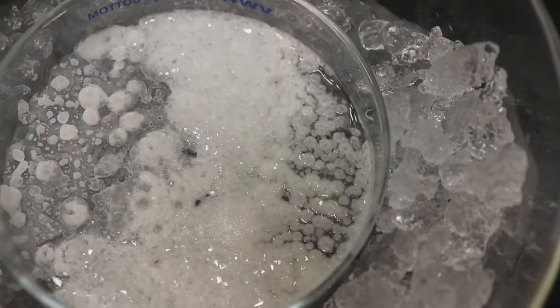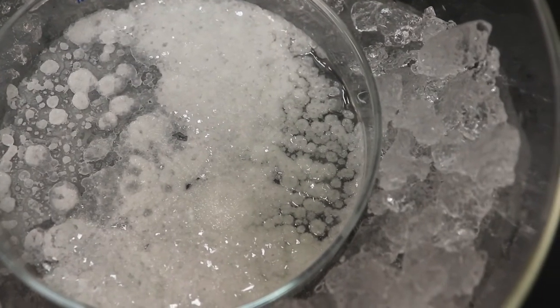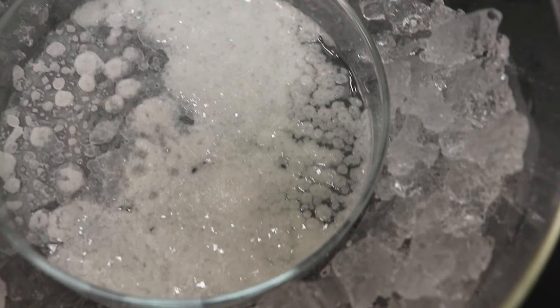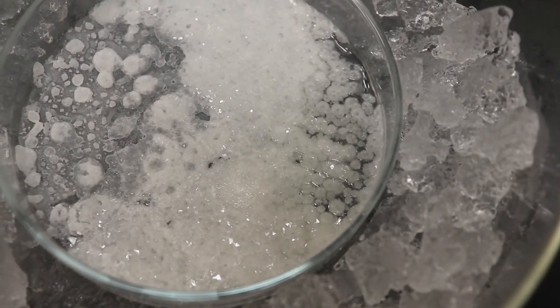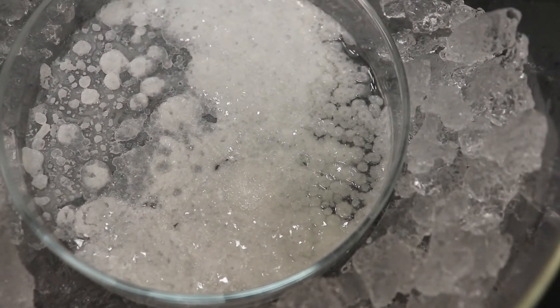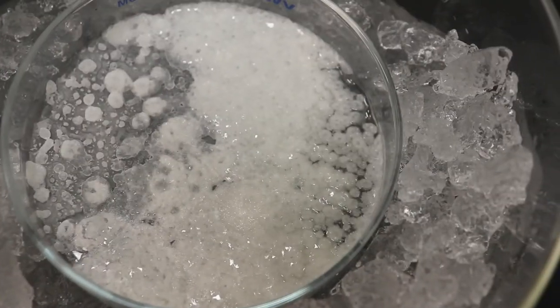I'm going to slow the video back down to normal speed, so you can hear what it sounds like as it's crystallizing. Hear those clicks? It's the crystals forming.